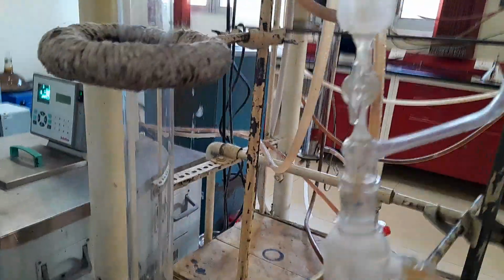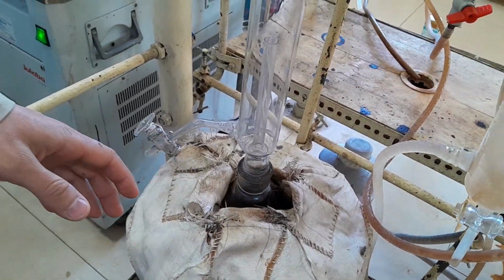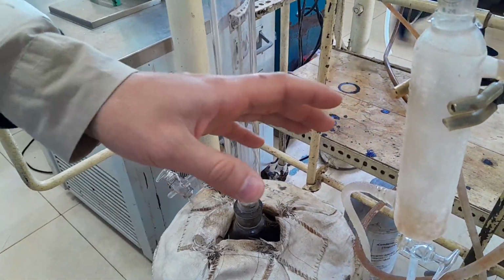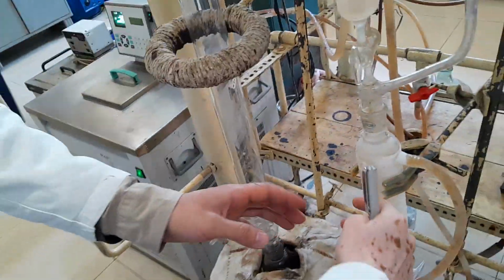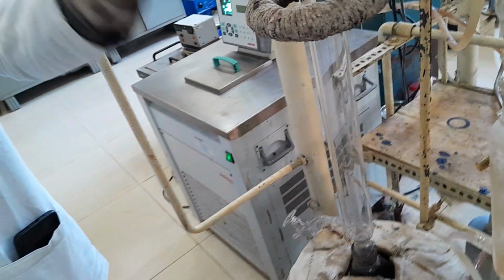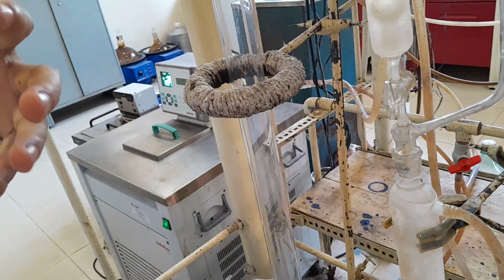See, it is heated up to say 70 degrees or 100 degrees. This side is minus, say, 10 degrees, and this is minus 20 degrees. So overall the temperature difference will be higher, so that the breaking down process will be more efficient. Exactly.